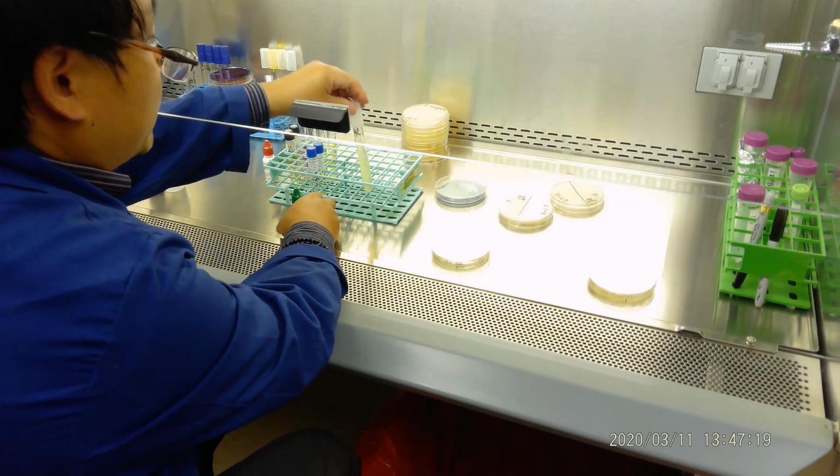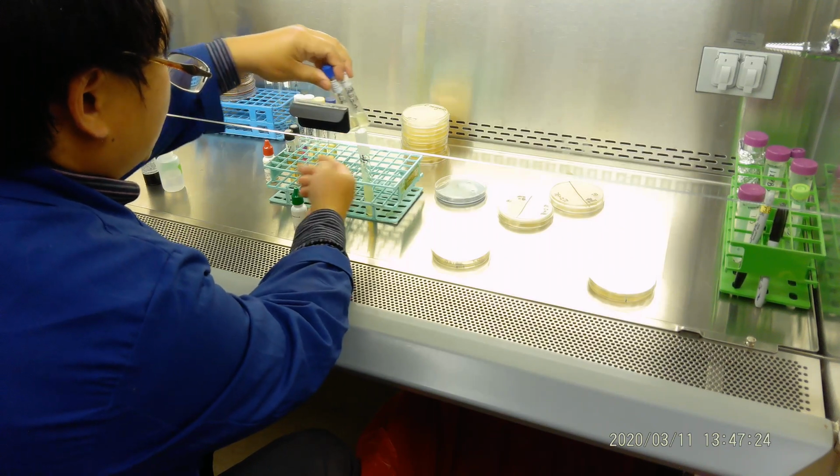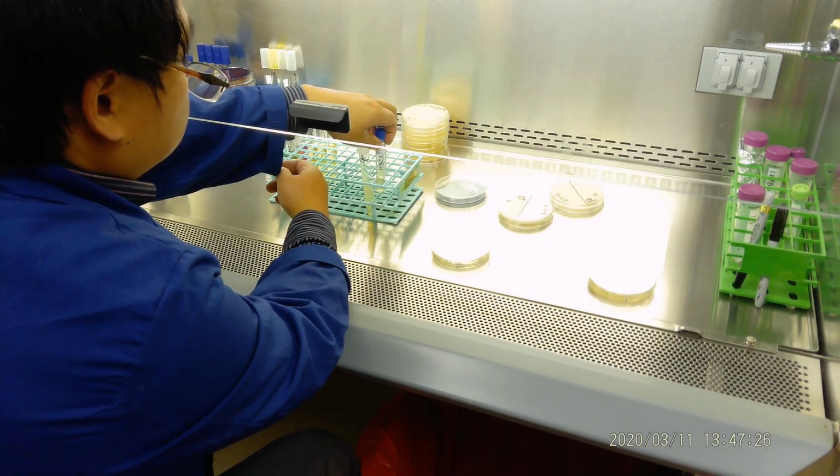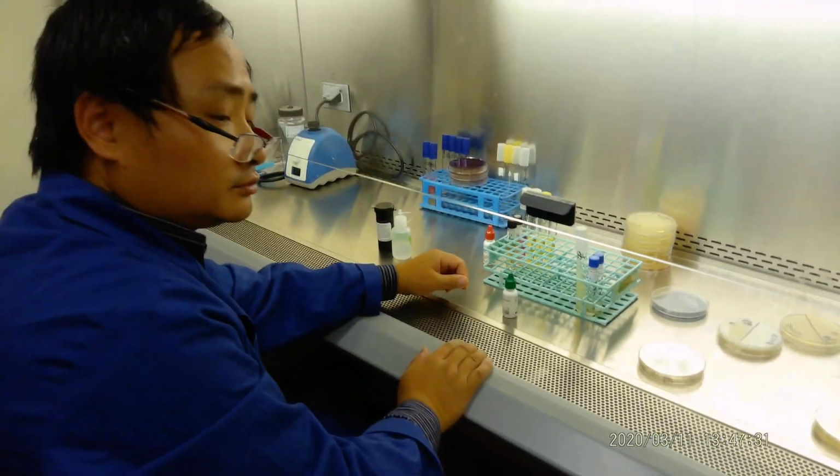We're going to come back to do the MR-VP test and also the deaminase test on Thursday. Okay? That's it.